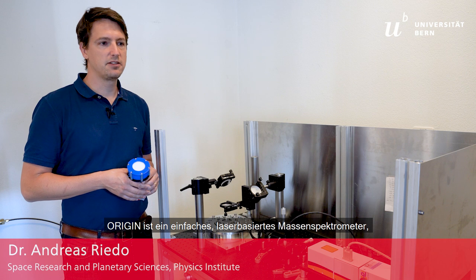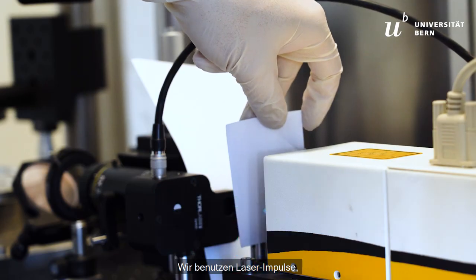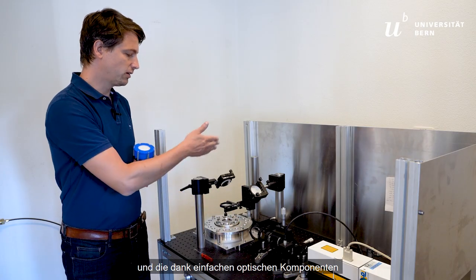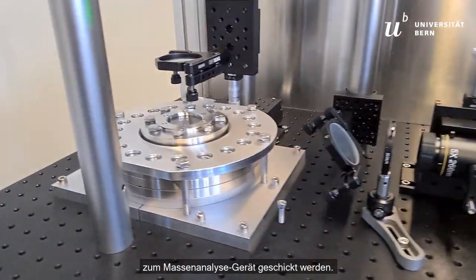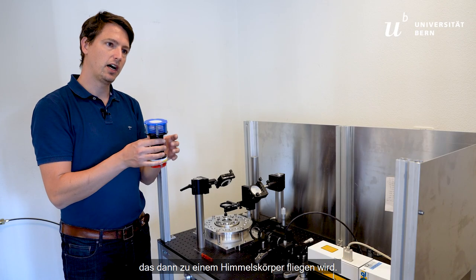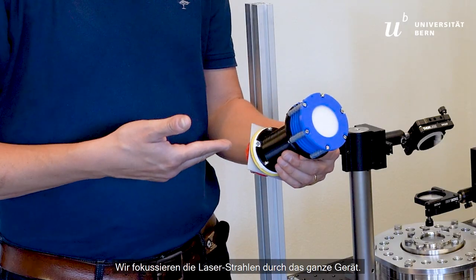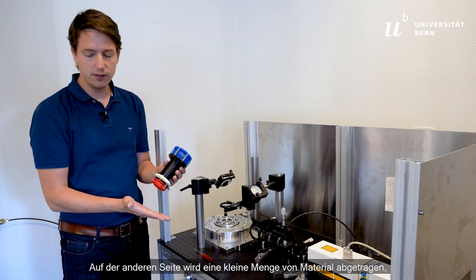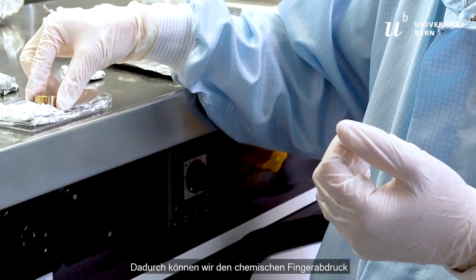Origin is a simple laser-based mass spectrometric setup, an analytical instrument. We are using laser pulses, which are produced by a laser system, guided with very simple optical components to the mass analyzer — the analytical instrument that can actually fly to a planetary body. We focus these laser pulses through the whole instrument, and at the other side, we lift up a very tiny amount of material, which is ionized.